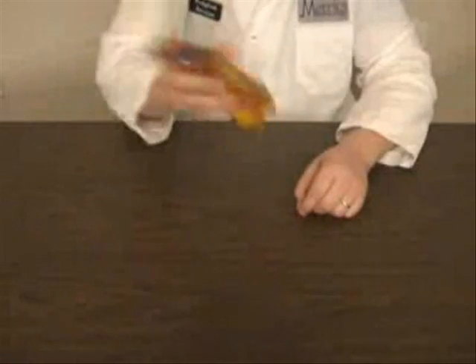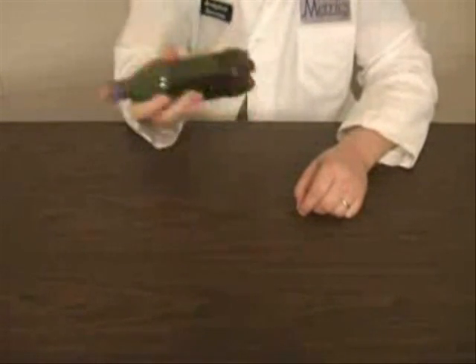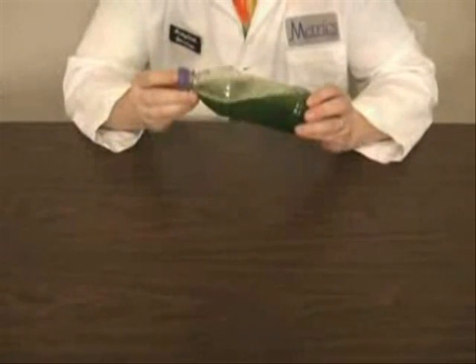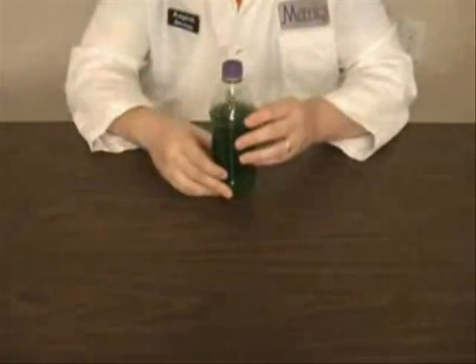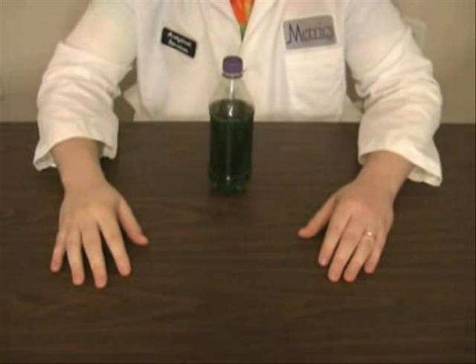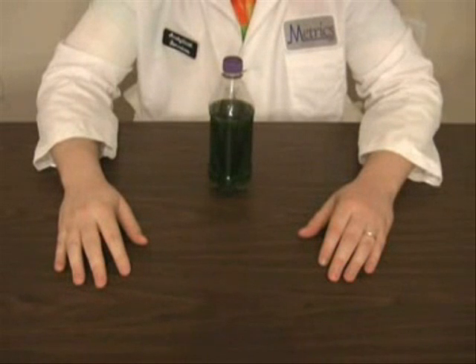Now that we've added all the components, we have an orange solution. Watch as I shake it once — to red, to green. And if I set it down and we watch it, it should turn back to orange.